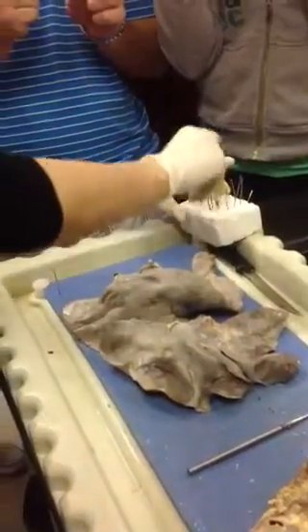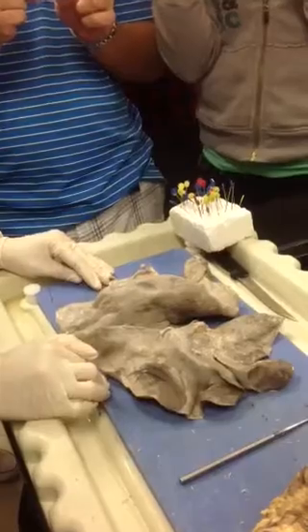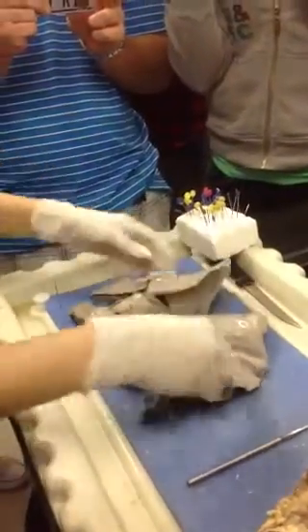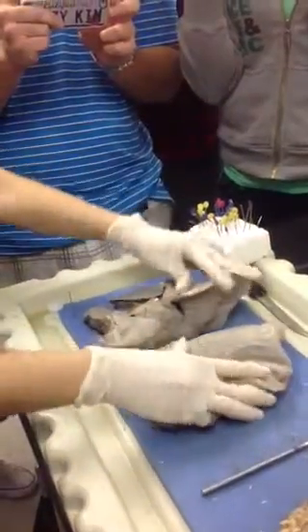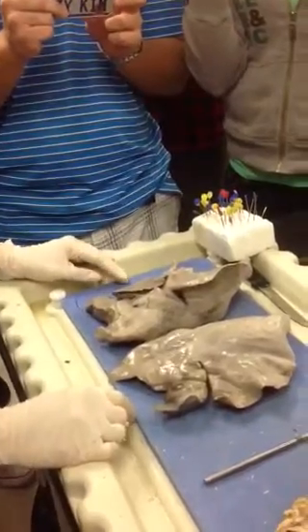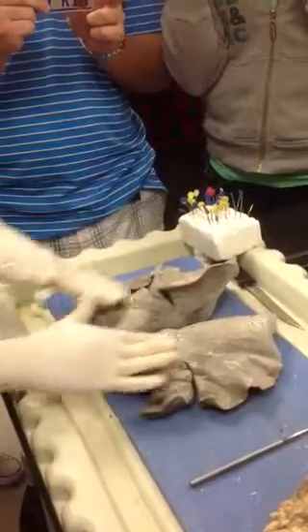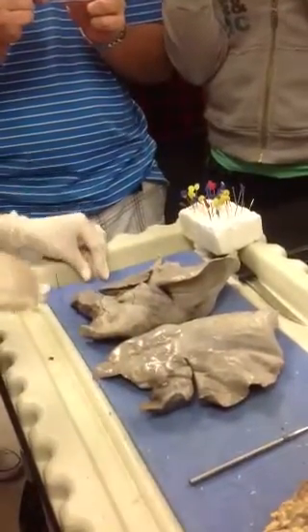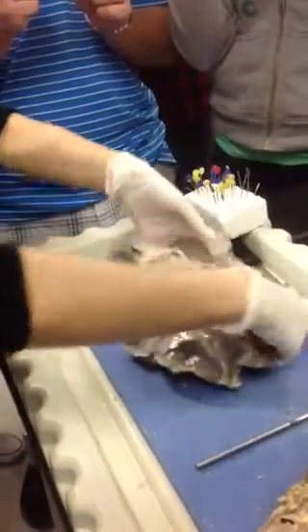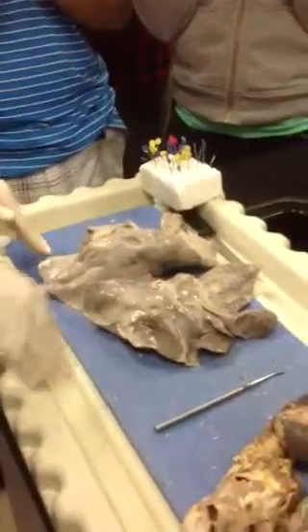All right. So again, what side of the lungs are we looking at here? Ventral. Ventral. So if we flip him over, and he's standing on all 4s, this is what side of the lungs? Dorsal. Dorsal. Also known as posterior. All right, so posterior is prettier, it's smooth, and it looks like a stingray. The anterior or ventral side is then ugly. Makes sense.